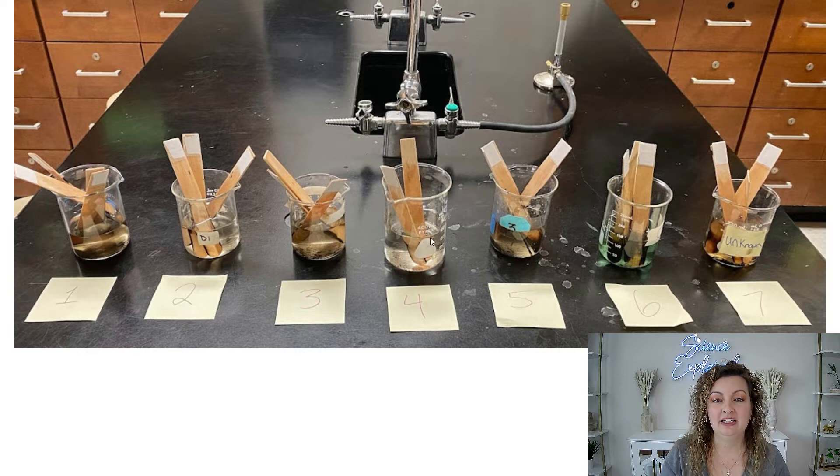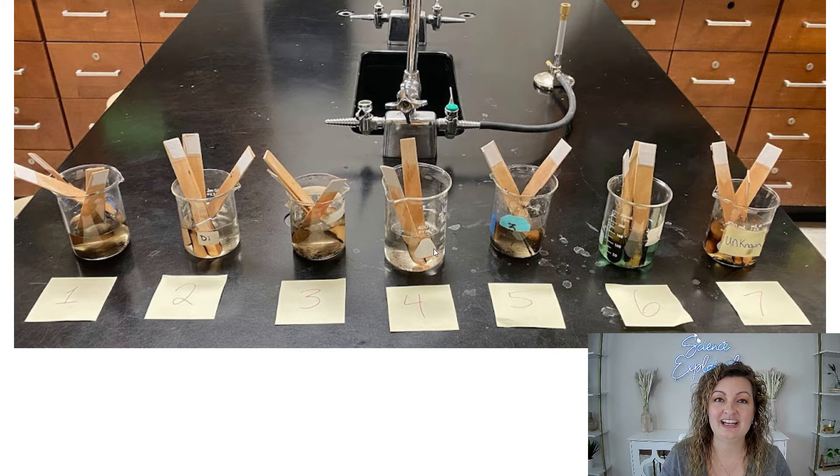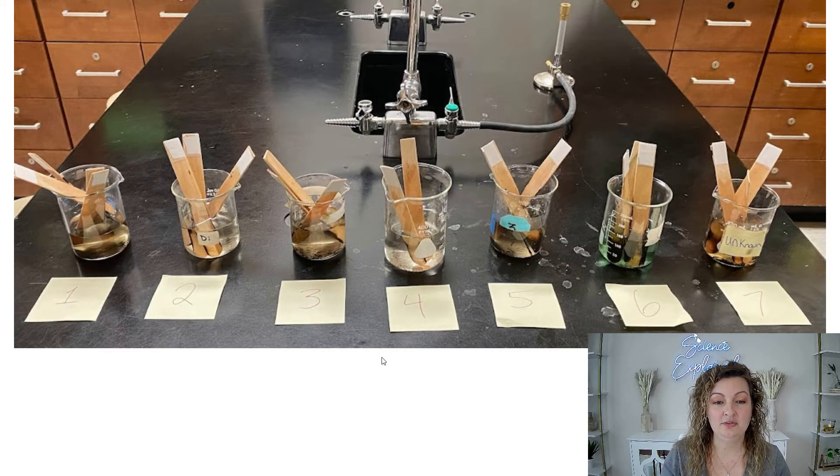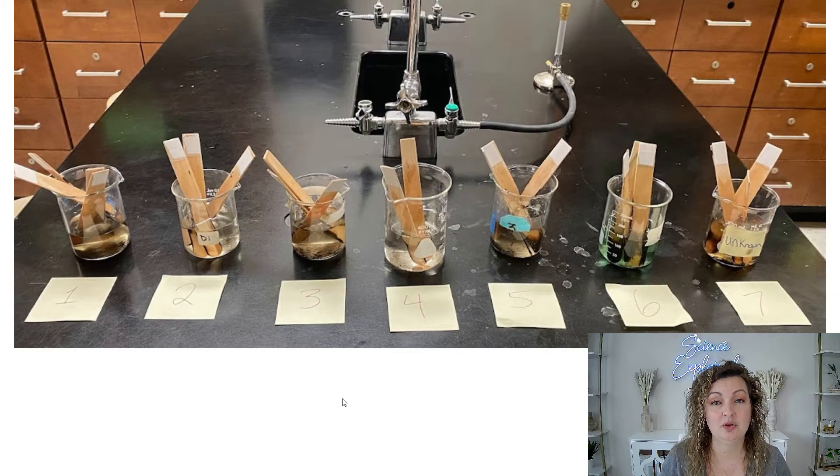Stir it up, dissolve it really well, and then I just pop some popsicle sticks in so they can get nice and saturated overnight, so that hopefully they don't burn the wood too much, because really we're just looking to burn the chemical in our lab.